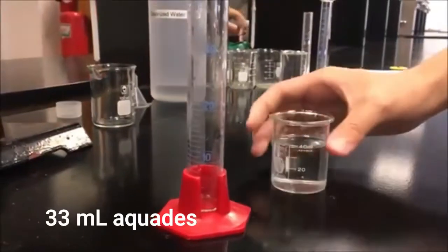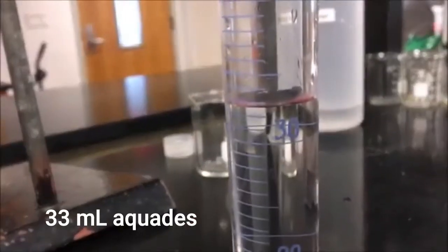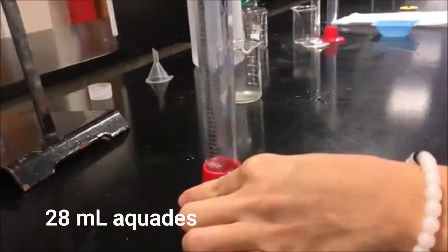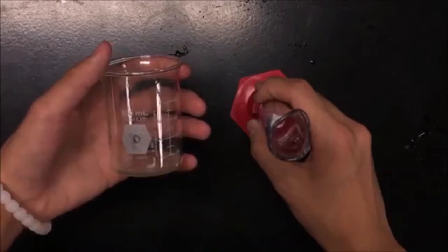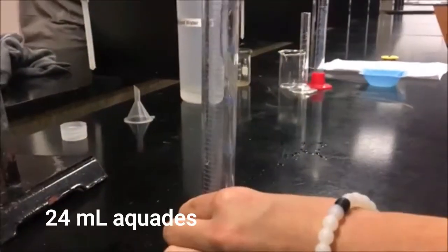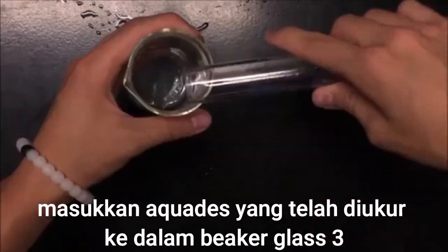There are 7 trials for this experiment. For trial 1, we need 33 milliliters of water, and add that to beaker 1. For the second trial, we need 28 milliliters of water. Add that to beaker number 2. For the third trial, we need 24 milliliters of water. Add that to beaker 3.